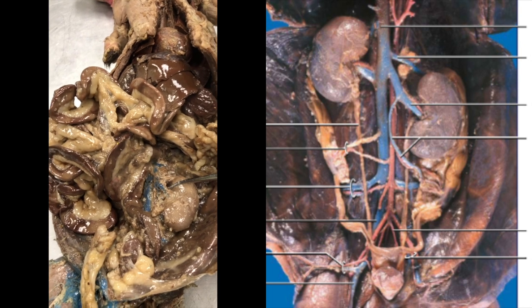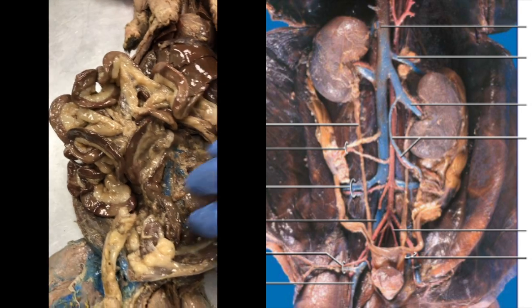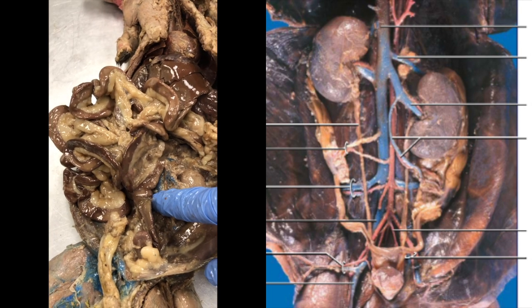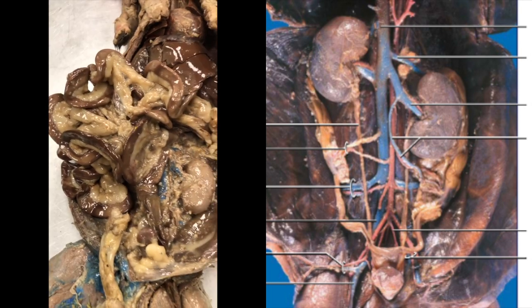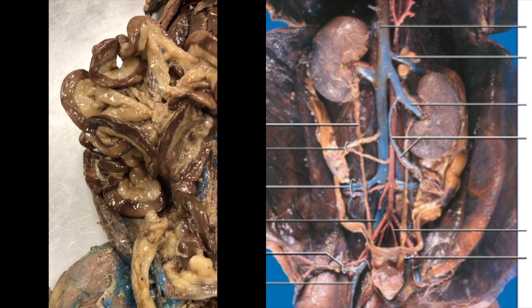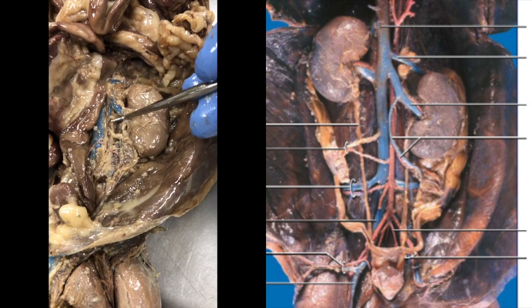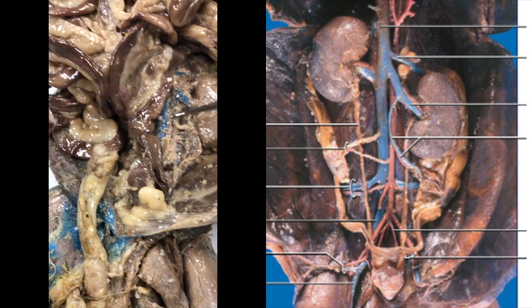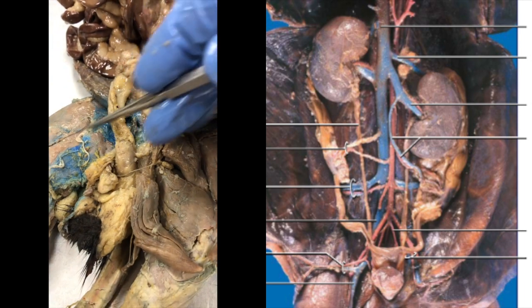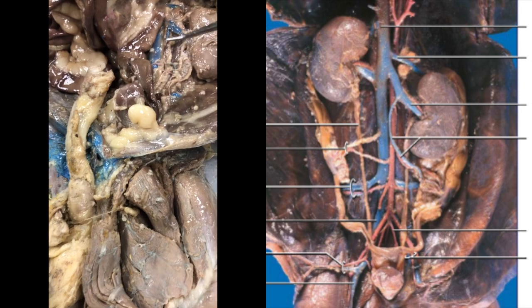So here's the left kidney with its supply. Here continues the descending aorta. Unfortunately, at this point, because this is a male, the next thing down that you would see would be the veins for the, and you can actually see it a little bit here. This kind of thin vein headed down, that one right there is the vein for the kidney. This thin vein heading down right here is going to head all the way down to the testes, since this is a male. That's the spermatic vein right there.